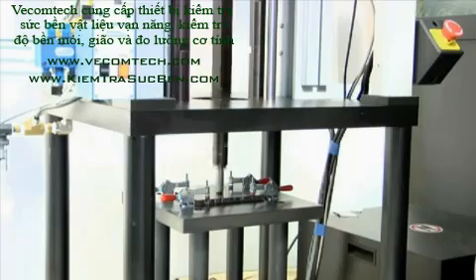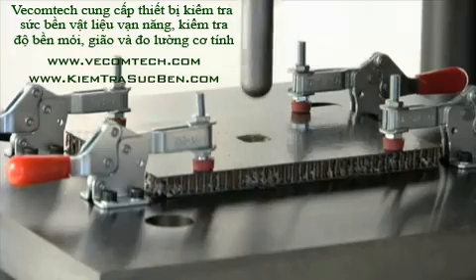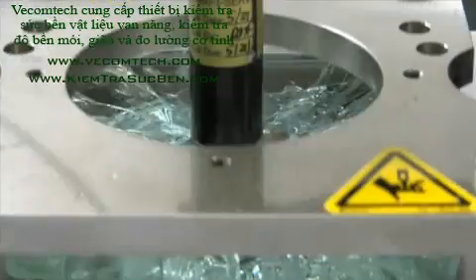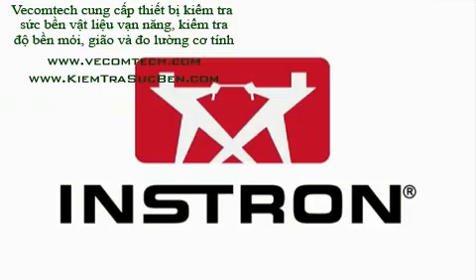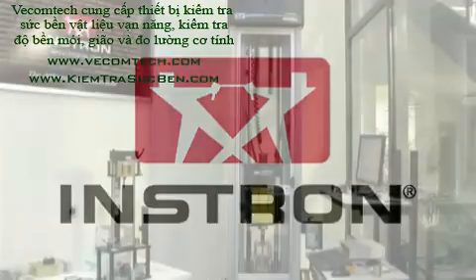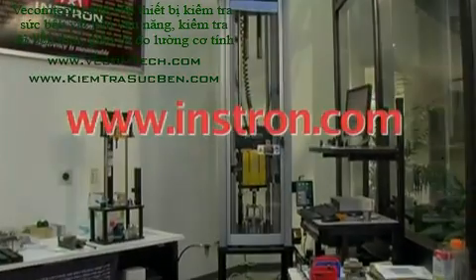Why is this important? Today's engineering designs require advanced materials. Performance with respect to weight, strength and cost have created the need for full physical characterization testing. Instron has created a vast line of materials testing instruments. With Instron, the difference is measurable.